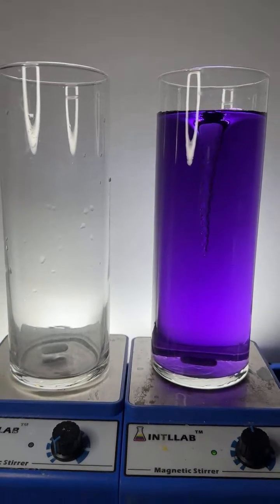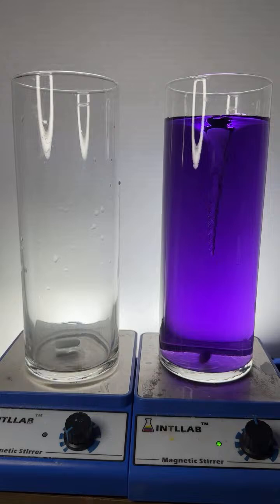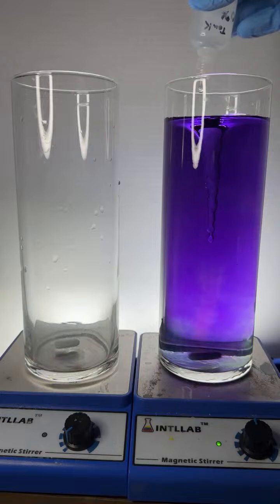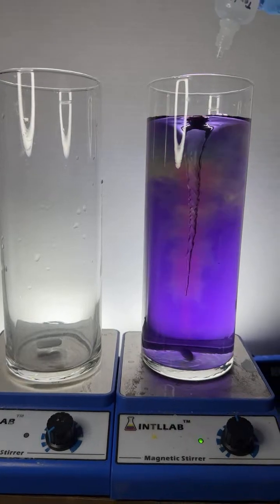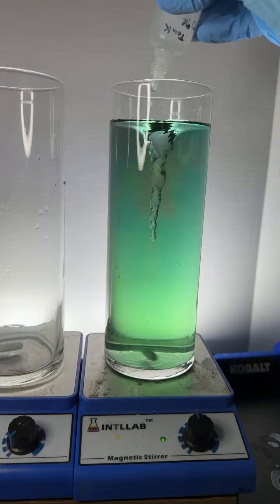Some science experiments, folks. We got them all set up over here on the right-hand side. Let's just watch what happens if I put acid or base into this flask on the right. I'm adding hydrochloric acid. It's the same acid that's found in your stomach. It's just what I use is 100 to 1,000 times more concentrated. Look at those beautiful color shifts. Aren't they pretty?